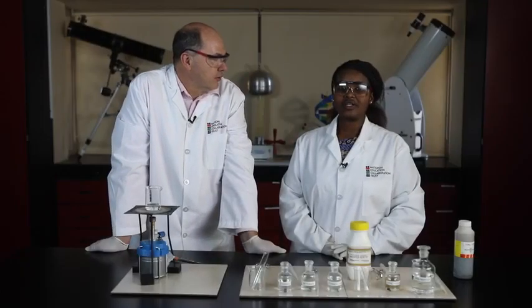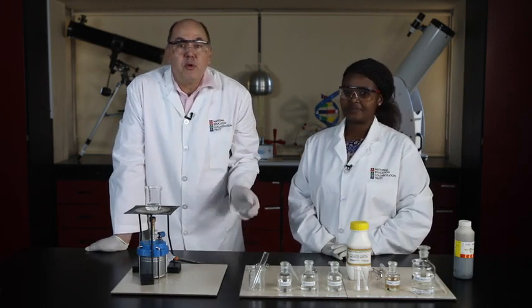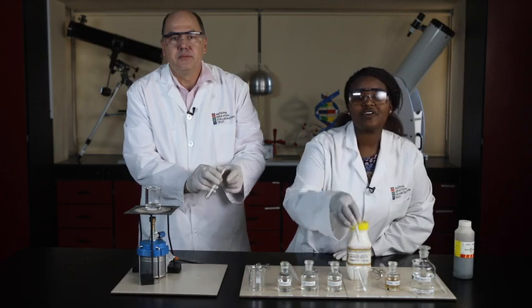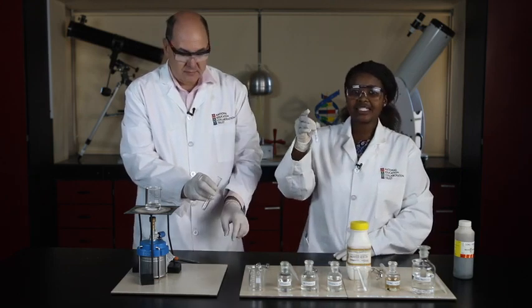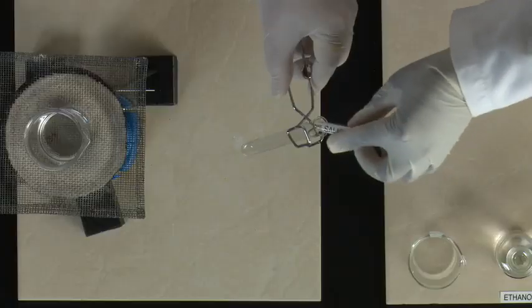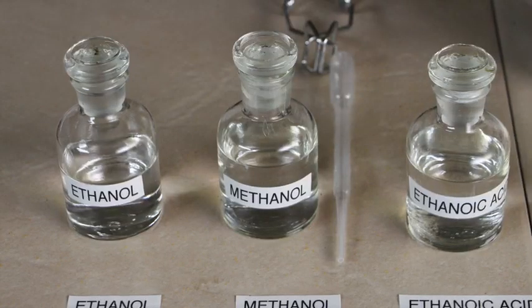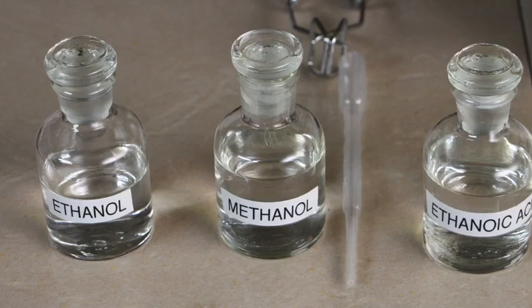When we work with a solid acid, we need to change our method slightly. Of course, we first start with a dry, clean test tube. Here it is. We have measured 0.5 grams of salicylic acid to use in this reaction. So we'll add the salicylic acid to the test tube. Let's take some of the methanol and rinse out the rest of the acid there.